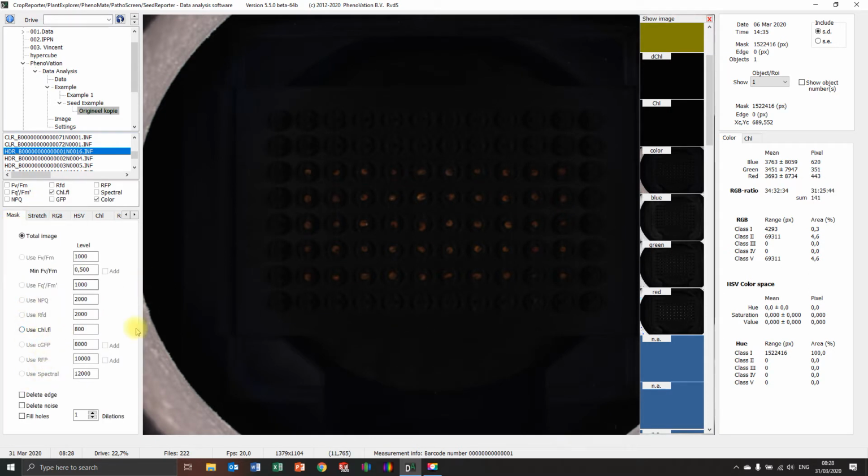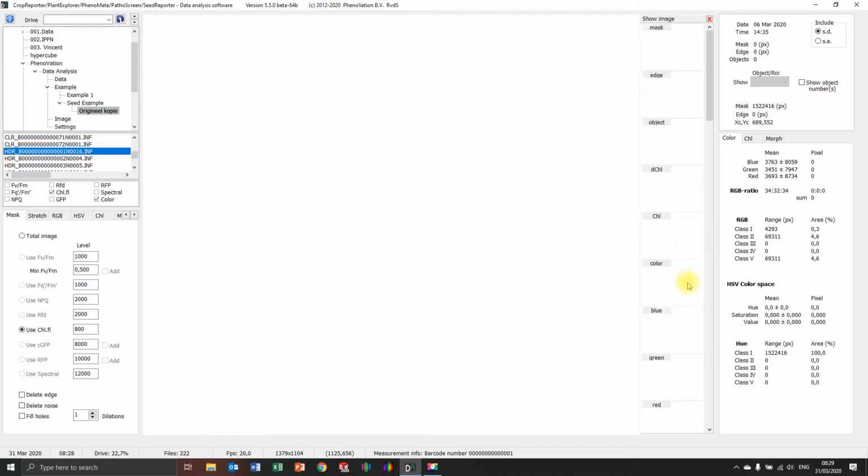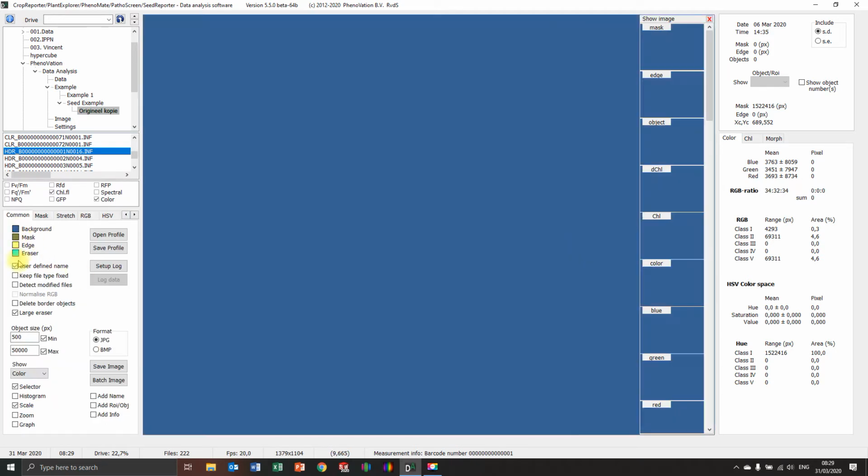First I'm going to mask it because I want to have the seeds out of the background. Well, every seed has fluorescence. So we're first going to use the fluorescence parameter to mask it out of the background. As you can see, instant white. Maybe that's the background color they've used. I can check that. Yeah, background. Well, I always put it in blue, so I put it back in blue.